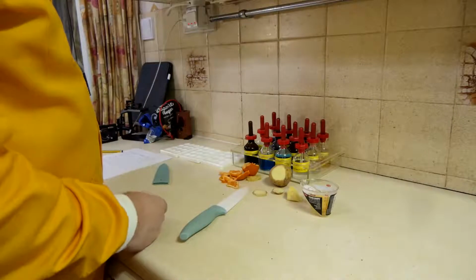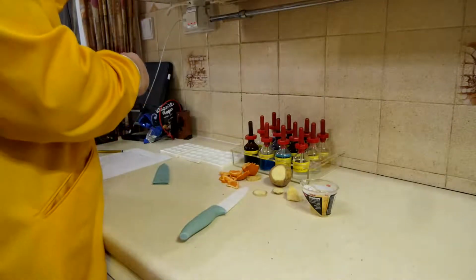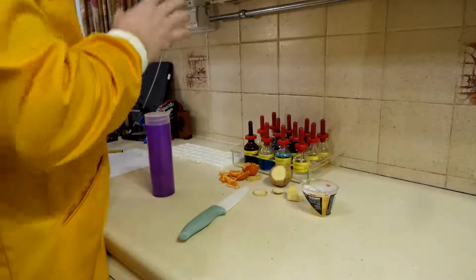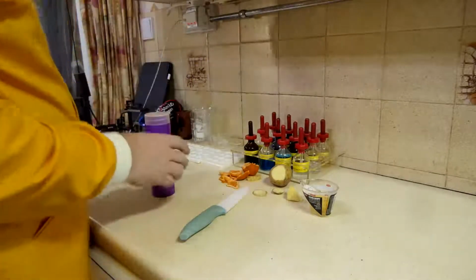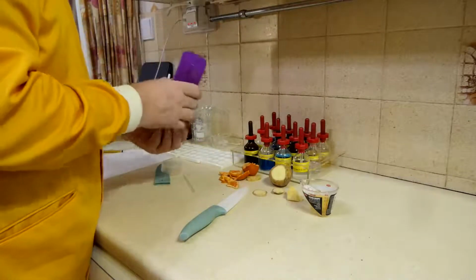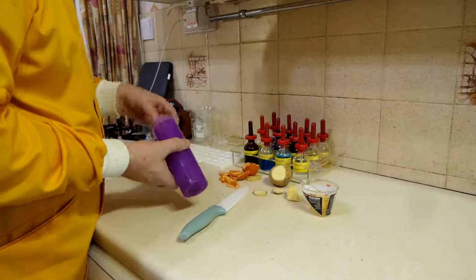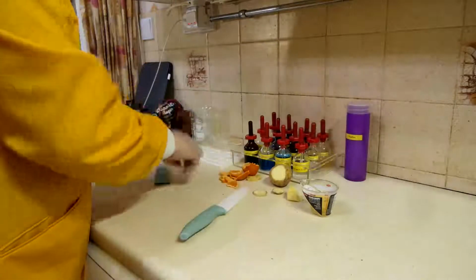What I want to do is test the egg, and it's going to be simplest for this one if I get some egg out, and to do that I'm going to use a pipette, not the usual one we use in the kitchen, I have to admit.